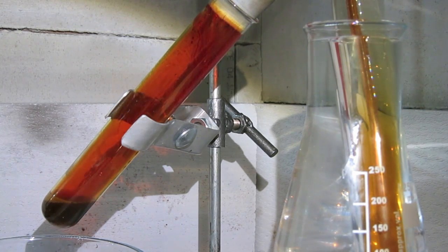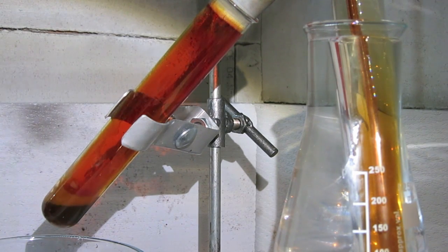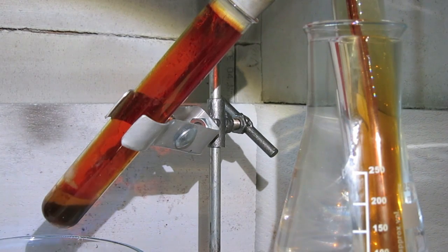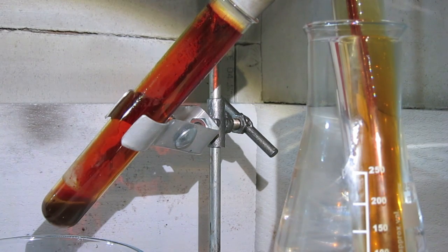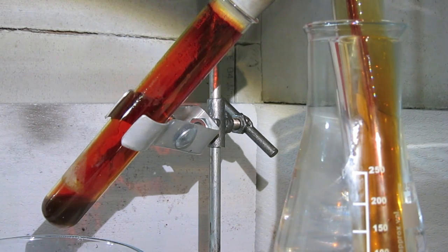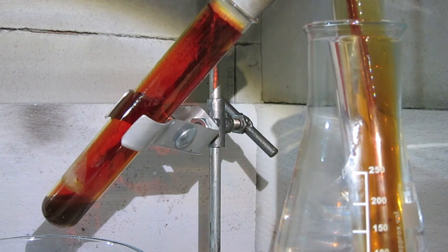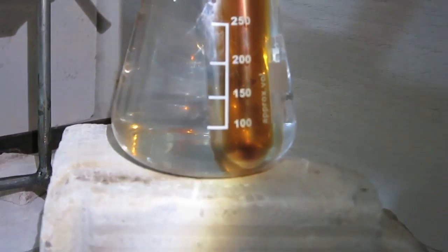And that is the yellow. I don't know where some bromine condenses. Because the boiling point of bromine is 58 degrees Celsius.